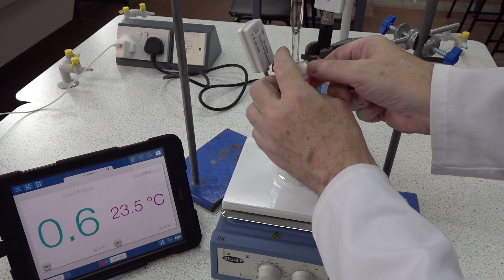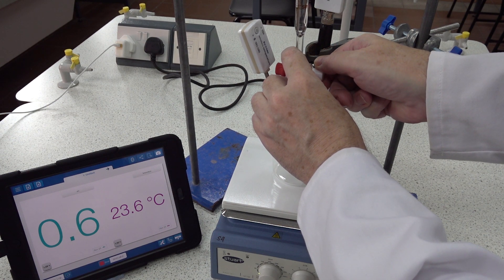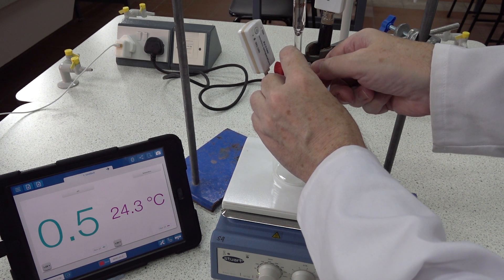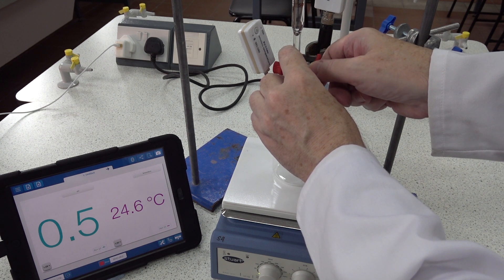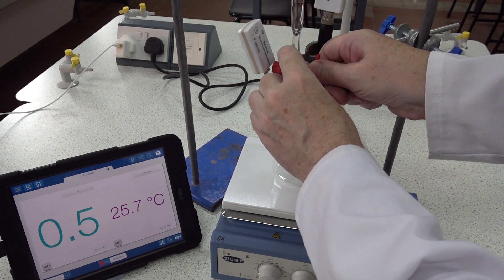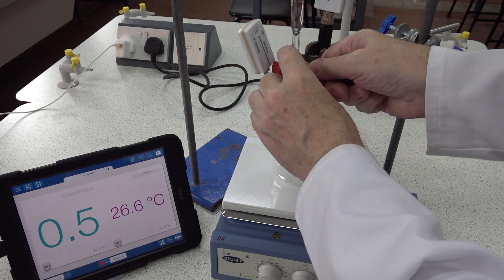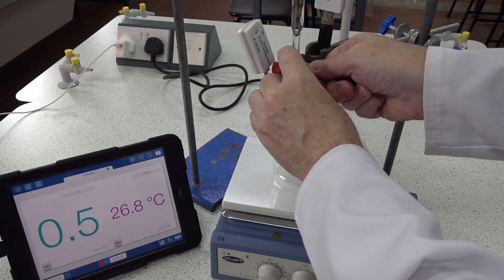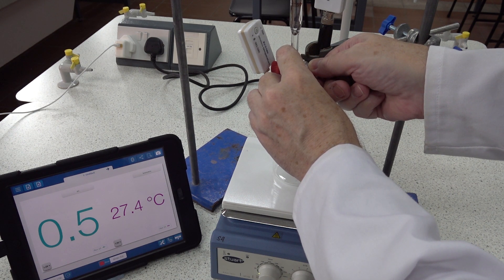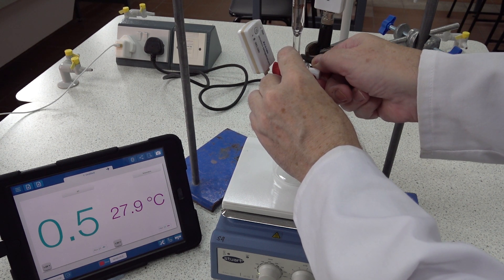So that's at zero — let's add one centimeter cubed of alkali. There's one centimeter cubed; here's the second centimeter cubed — that's two. Let the reading stabilize briefly. Now we've got three centimeter cubed, four centimeter cubed, five centimeter cubed.